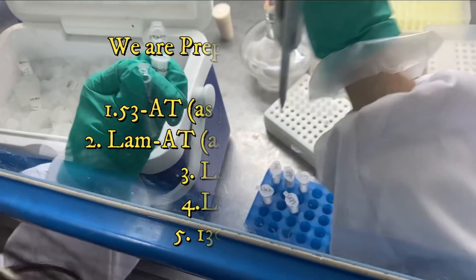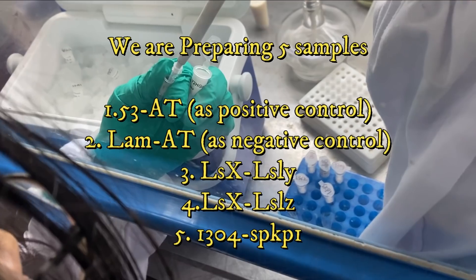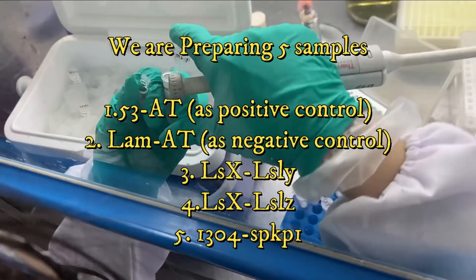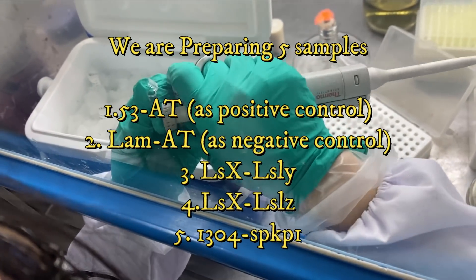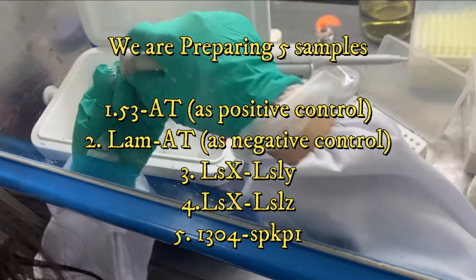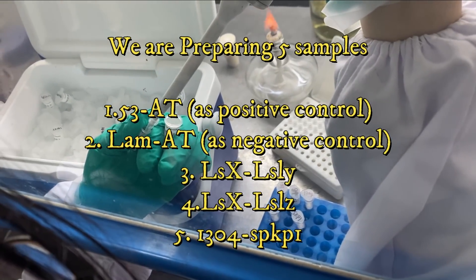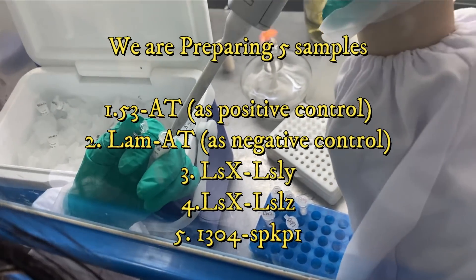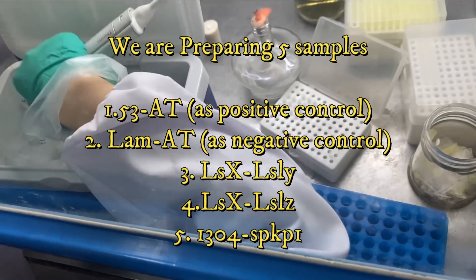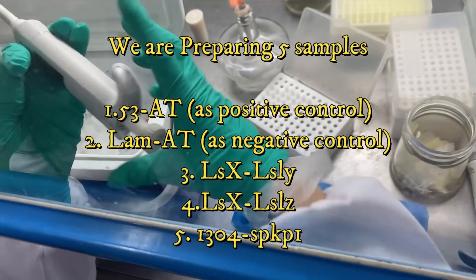While transferring the ingredients to Y2H gold buffer, I will explain why we are preparing 5 samples. One sample should be prepared as a positive control. It is already reported in literature that p53 and AT as AD and BD vectors interact, so we are using them as a positive control. LAM and AT never interact as reported in the literature, so we are using them as a negative control.